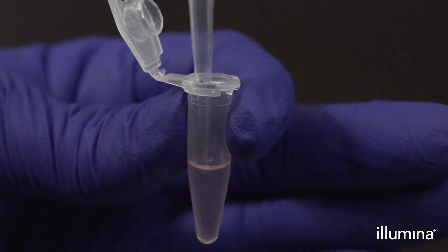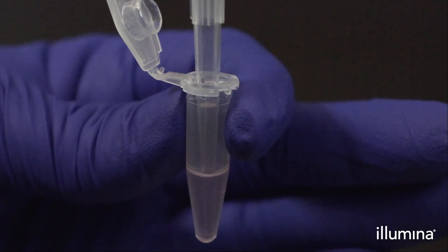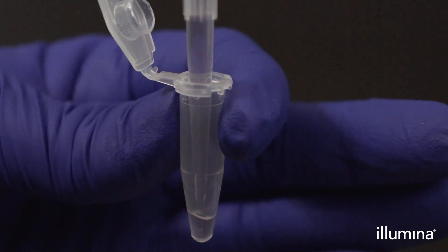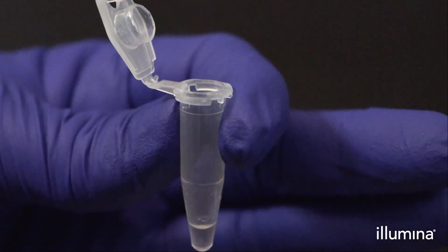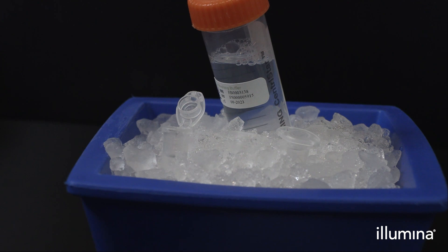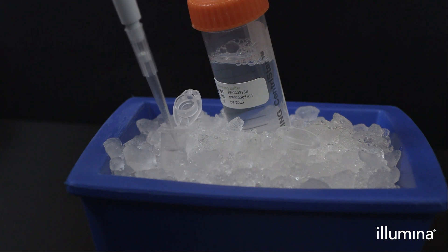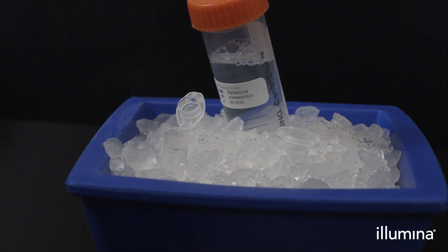With a P200 low retention pipette, slowly aspirate 180 microliters of the pips from the 0.5 mil sample tube and transfer that volume into one of the 1x wash buffer aliquots in the 1.5 mil tubes. Briefly centrifuge the remaining volume in the 0.5 mil sample tube on a benchtop minifuge to bring the liquid to the bottom of the tube.